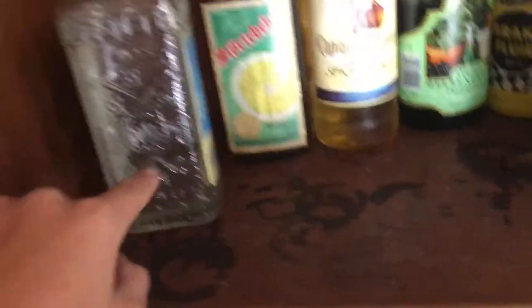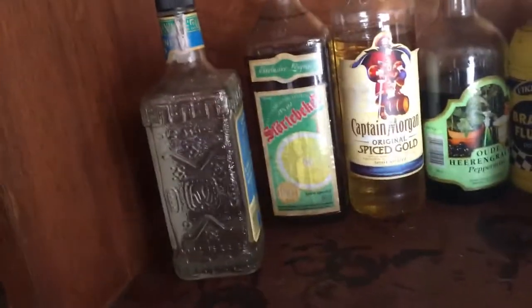Basically, I've only used 500ml of this bottle, as you can see there's still some left. And basically, that should give me 120ml of alcohol. This stuff should give me a lot more, and I still have three bottles to go, plus a little bit.